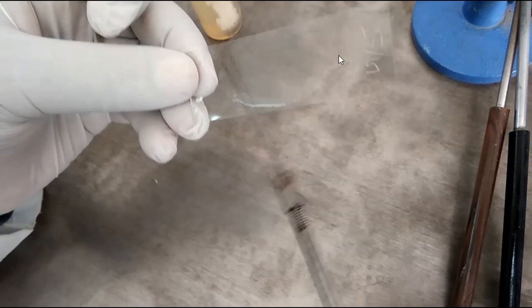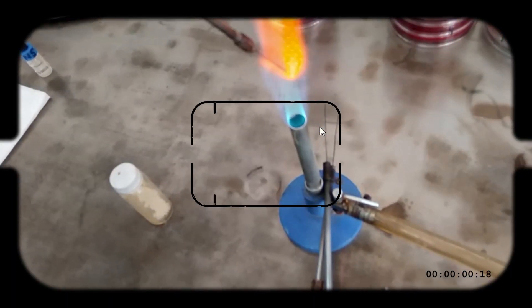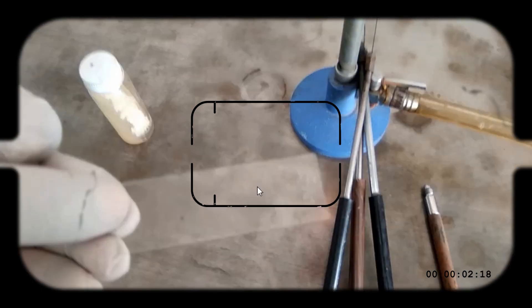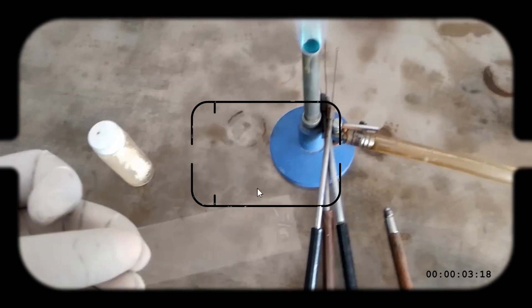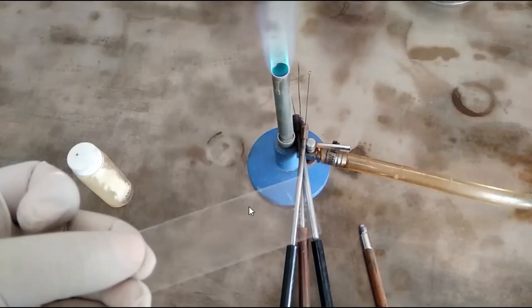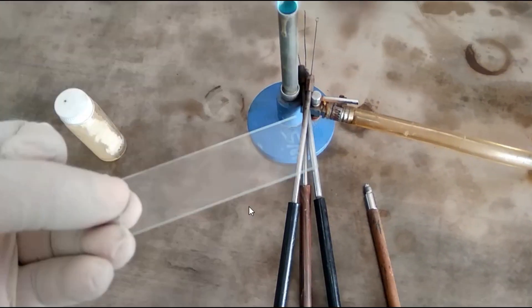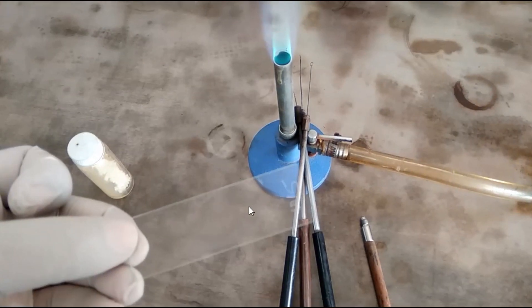Now prepare a smear in this way. Leave for air drying. After that, heat fix. Then perform gram staining in this way.